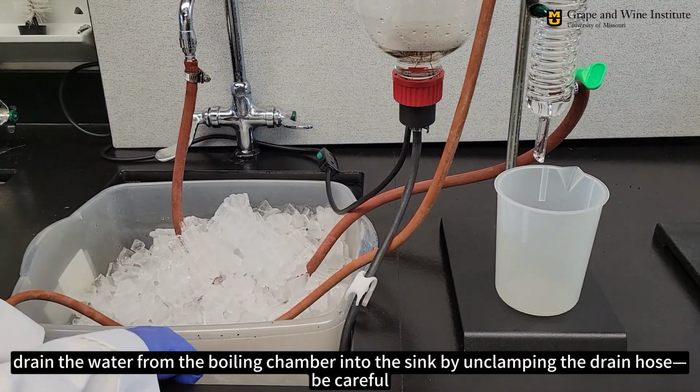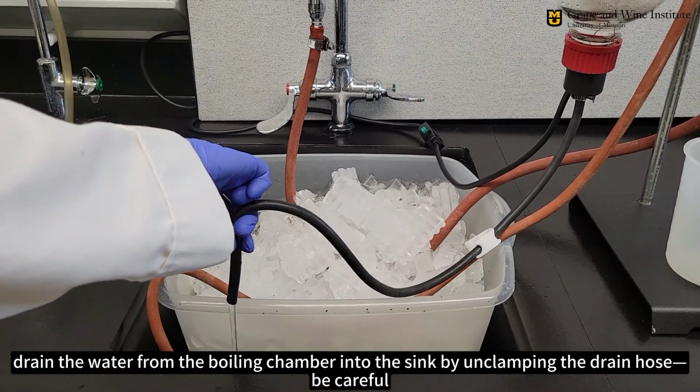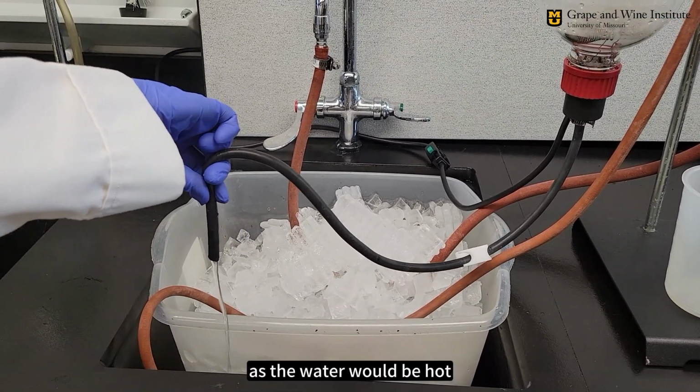If you're done, drain the water from the boiling chamber into the sink by unclamping the drain hose. Be careful, as the water will be hot.